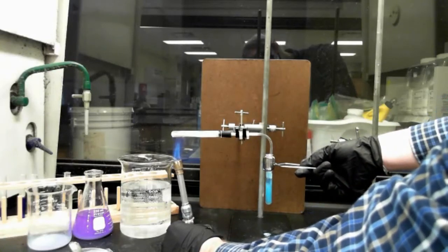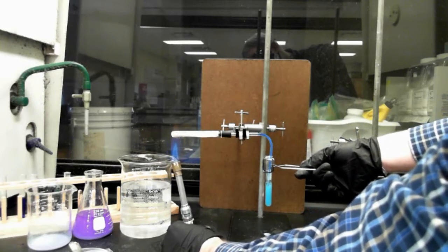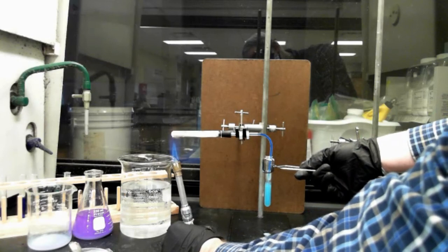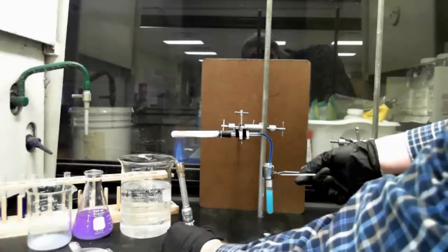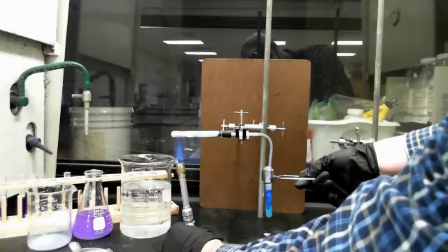So now notice I'm getting a precipitate. Oh, there it goes. It sucks back in. It's not supposed to suck back in, but it is. And then it'll blow it back out here.